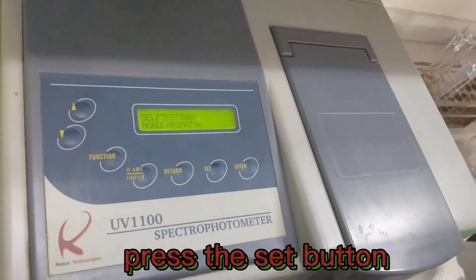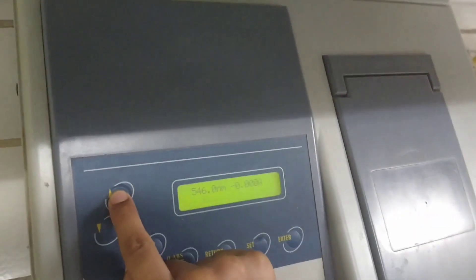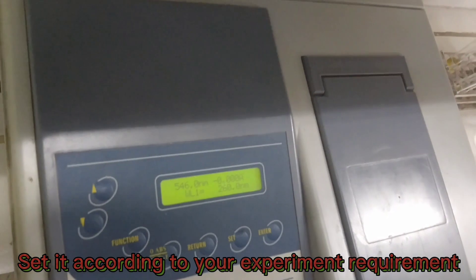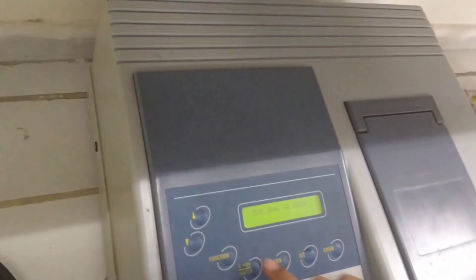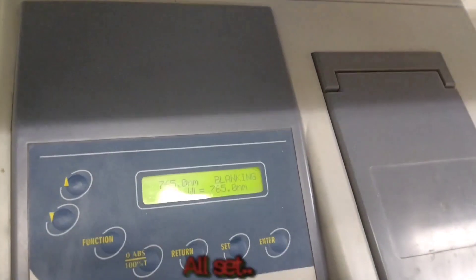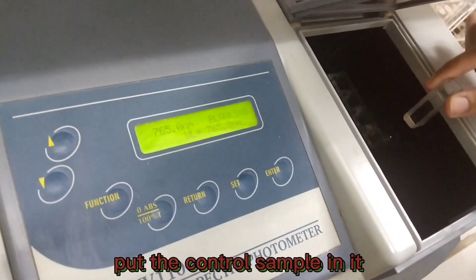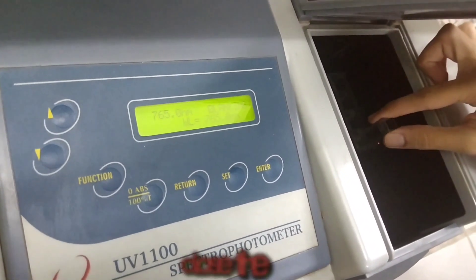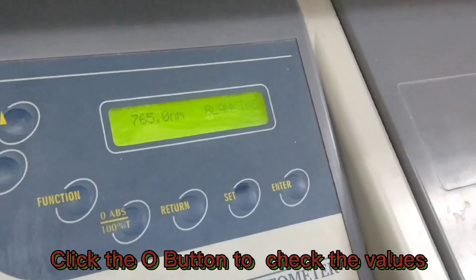Press the set button. Set it according to your experiment requirements. Use upper and lower keys for this purpose. You can see it's all set. Now put the control sample in the cuvette and place it in the device, and cover the lid.